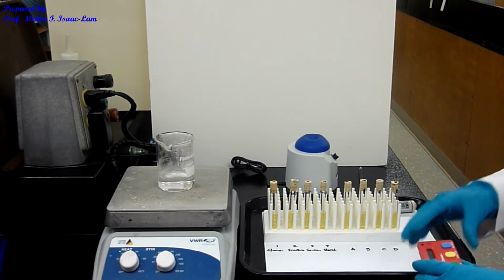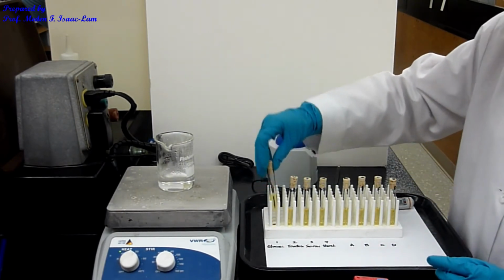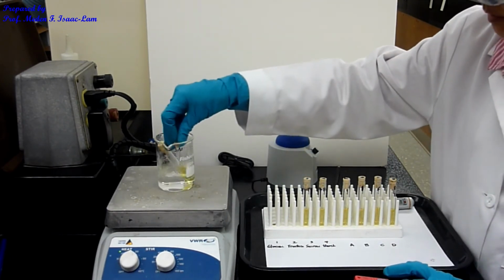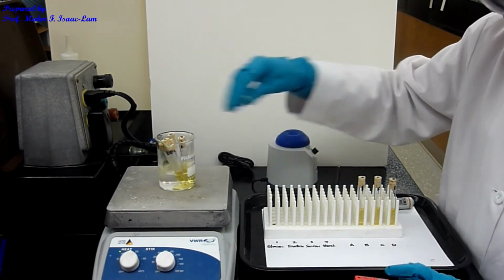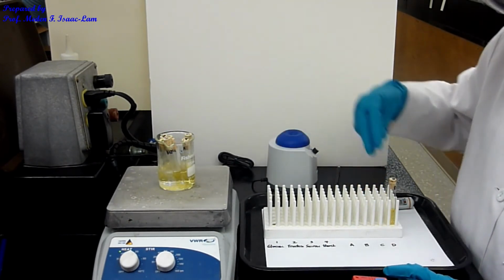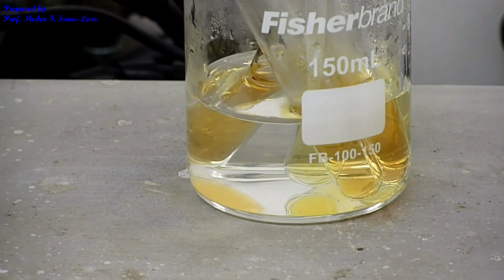set the timer. So we're gonna determine which one will react first or change color. I'm now gonna put everything in here. I'm gonna start the timing, and then we're gonna watch what happens. Okay, so I put everything in. So let's take it out. It's been about 5 minutes already.